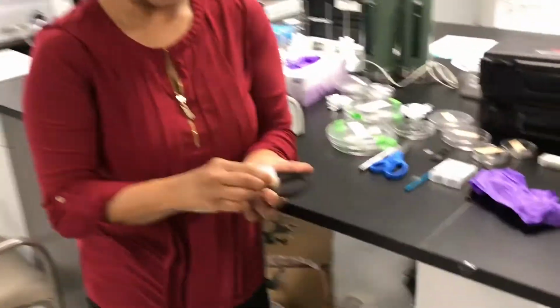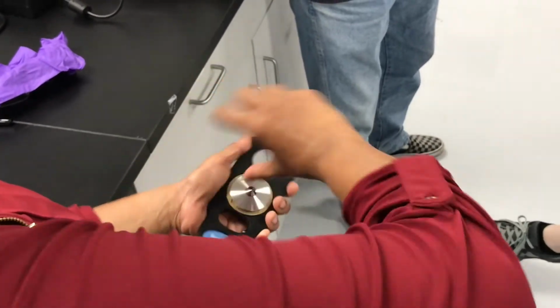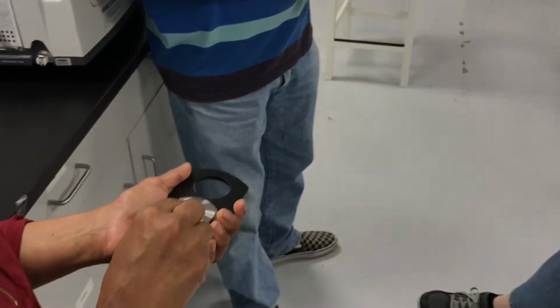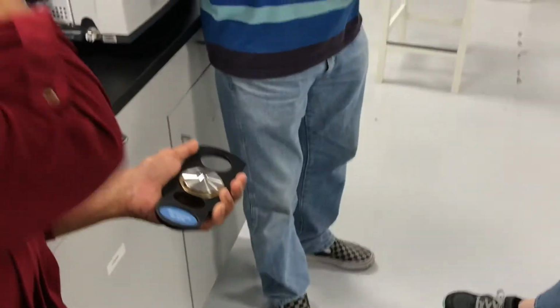And it has a cover on it. This is just to protect the crystal, but don't turn it because the alignment of your ring depends on it if you just twist and turn or move it around. So I would say, don't play with it. That's very important because the alignment of the crystal is important so that the energy really goes through the tip and reaches where your aperture is set up.